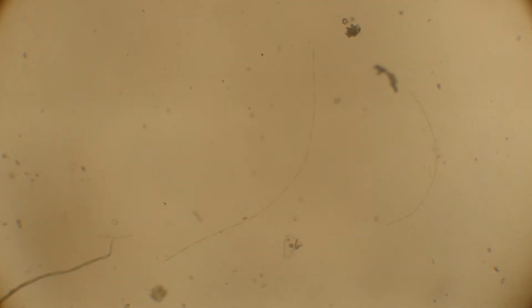Then we go to the 10X D-plan. And we lost our algae. Where are you, algae? Is that it there? Okay, that's it. So definitely not. What do they call that? They don't work together, 2 objectives. So there it is at 10X.